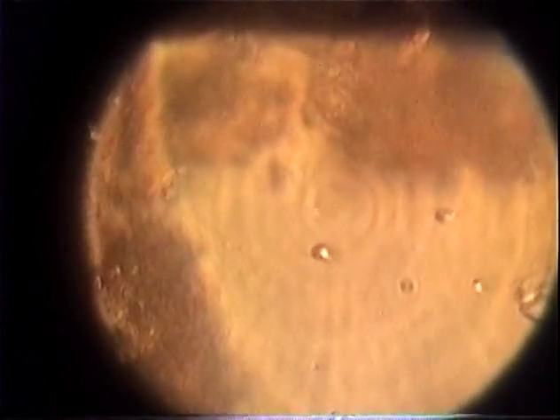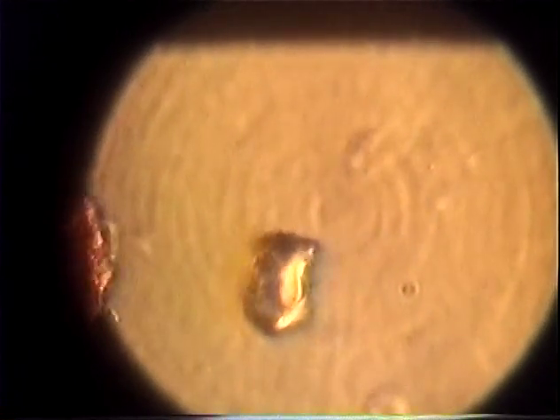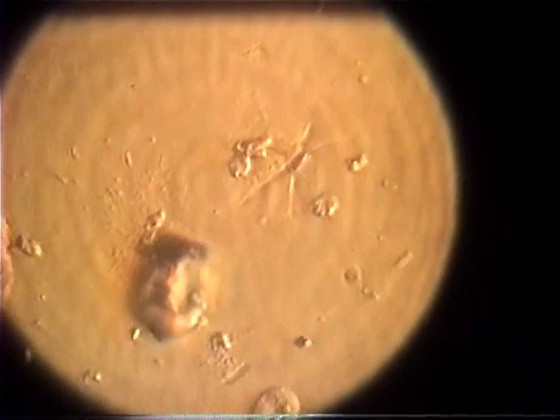Let's zoom in again. These are very fast movers, and we're going to have a hard time seeing them. They're actually pretty small, but let's check it out. Unless we add some glycerin. That's what I brought the glycerin for. Otherwise we're not going to be able to catch them. They'll be too fast and zoom out. What's the glycerin? Glycerin is a thick, oily stuff, which will keep them from moving. Let's put glycerin on them.